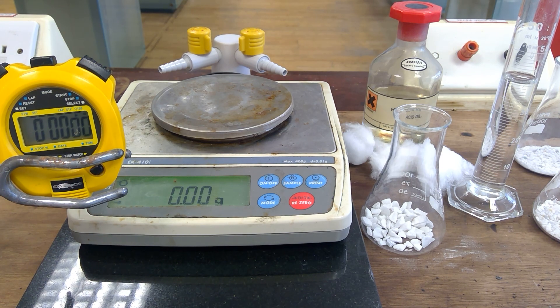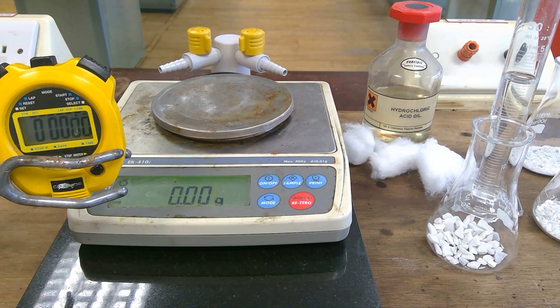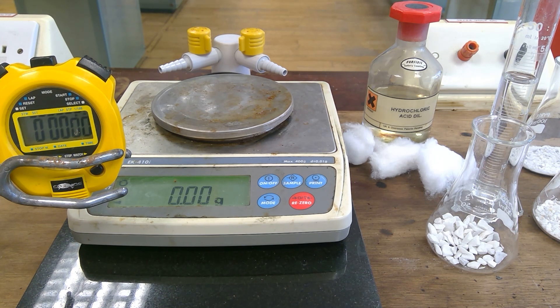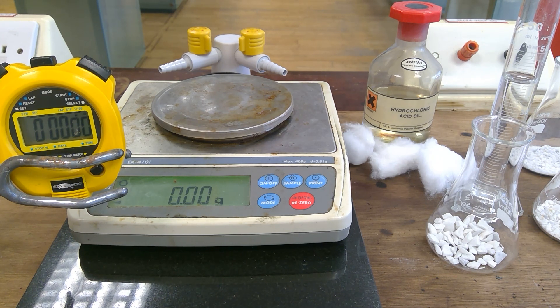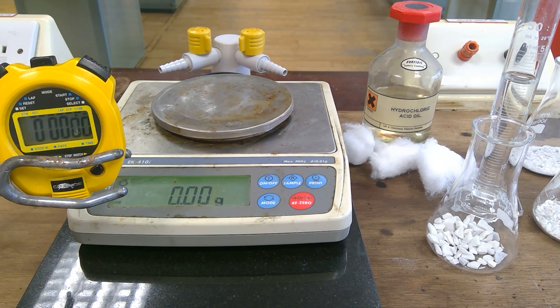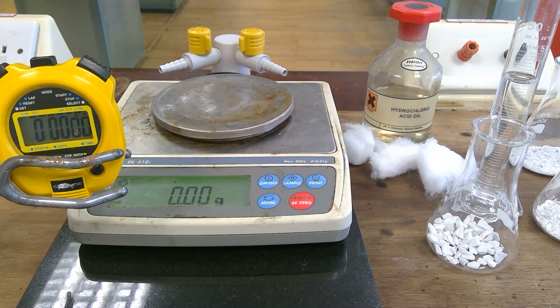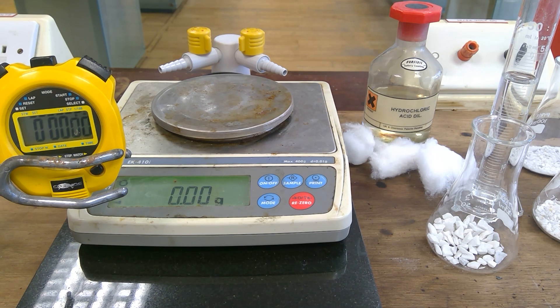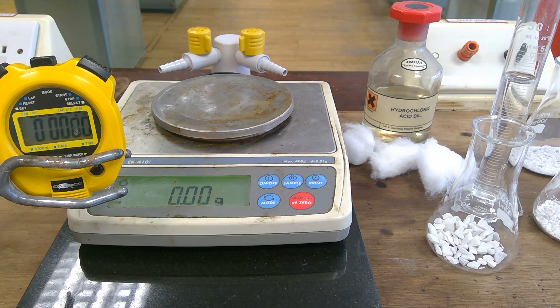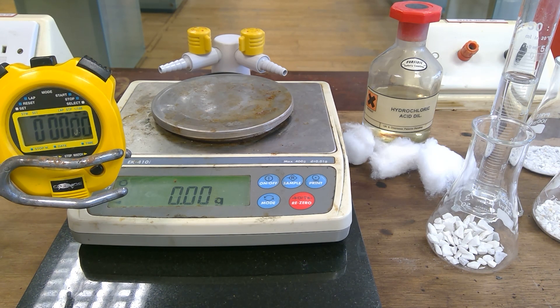This is an experiment to look at the effect of surface area on the rate of a chemical reaction. The reaction we are looking at is between calcium carbonate and hydrochloric acid, which produces carbon dioxide gas. The hydrochloric acid and the calcium carbonate will be mixed, and because the gas escapes, the mass will decrease. So we will measure the mass loss against time.